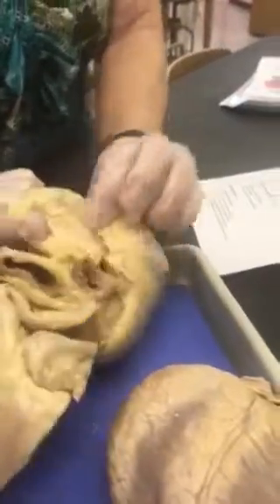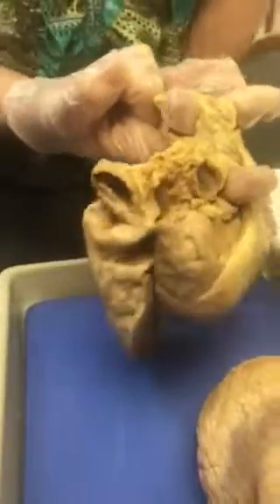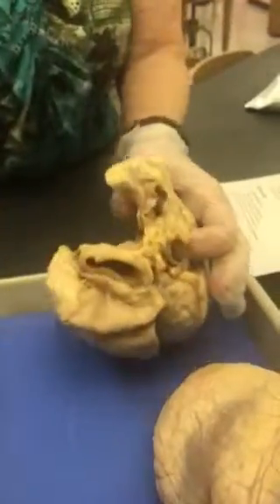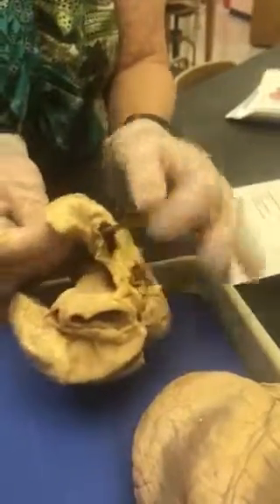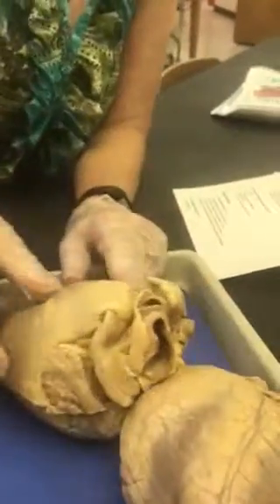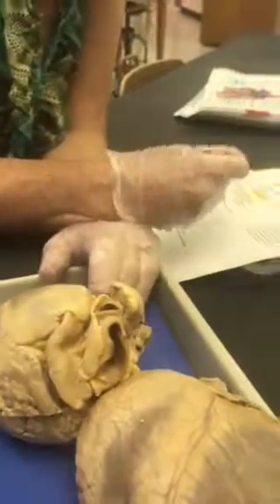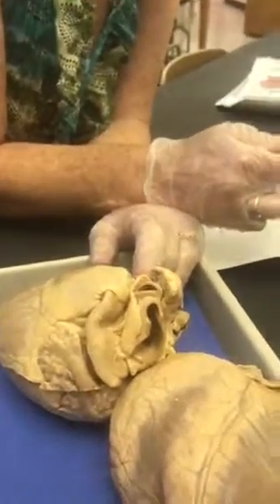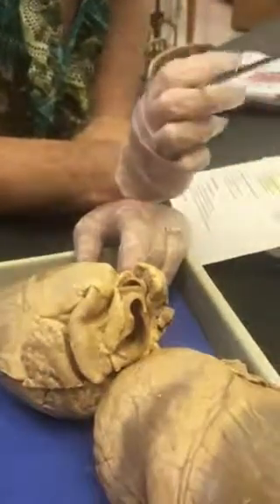Let's see if I can locate them on this pig heart. That's the back side of the heart. There's the superior vena cava. And there's your inferior. Okay, will those be asked on the model or on the live part? Just like this. So I'll have probes through there, you know, so you can see them, and then I'll have a pin in one or both. Okay, I think that's everything. Just checking. It's everything.